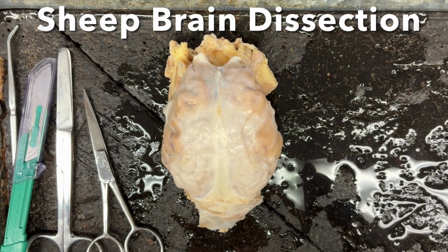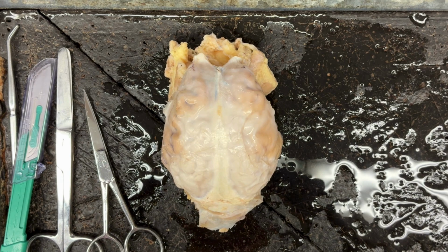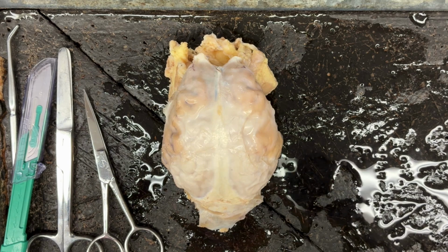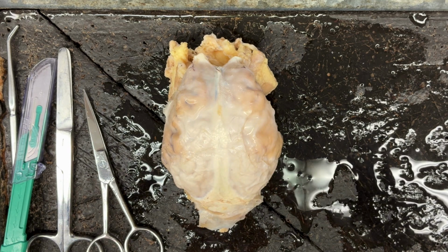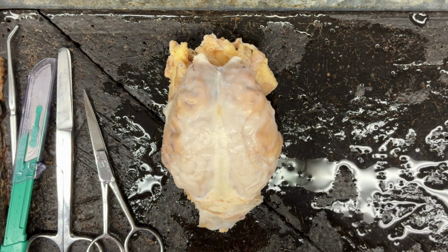In this video, we are going to walk through a sheep brain dissection. You'll complete a similar dissection in lab, and this will help us take a look at some of the different parts of the brain on an actual preserved specimen.